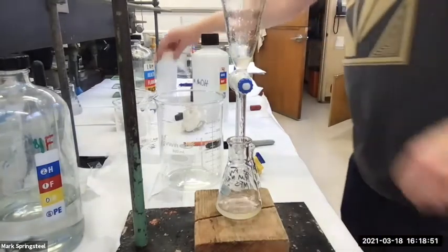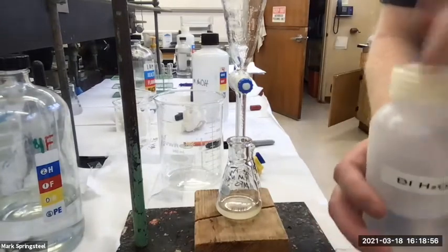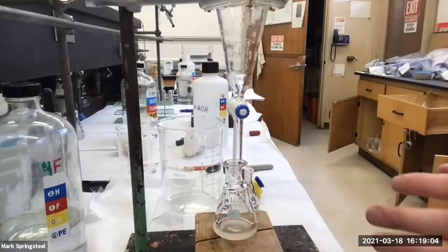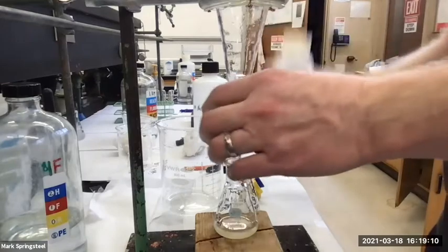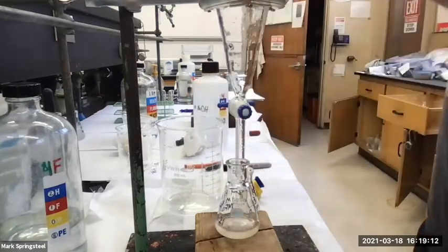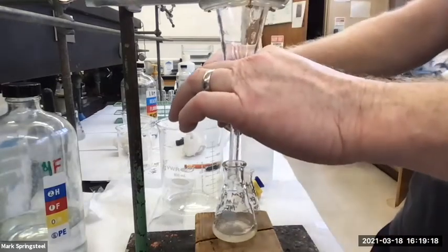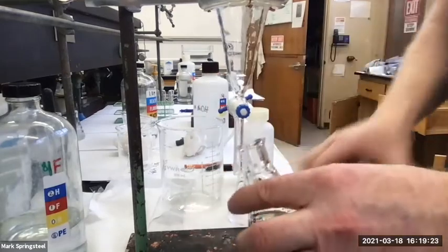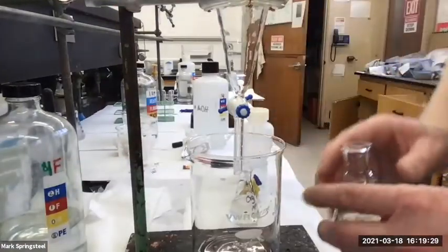I'm gonna give it a little DI rinse. This is gonna be two things I'm gonna do. I'm gonna rinse a little deionized water down through the top, and what that's gonna do is wash it out. And also it's gonna confirm that this is the aqueous layer, because if it isn't the aqueous layer, I should see a separate layer forming down below. There we go. Now I'm gonna drain that out. Okay, looking pretty good to me. And I'm gonna right away put my safety beaker back underneath, so if I make a mistake later, I know I got something under it.